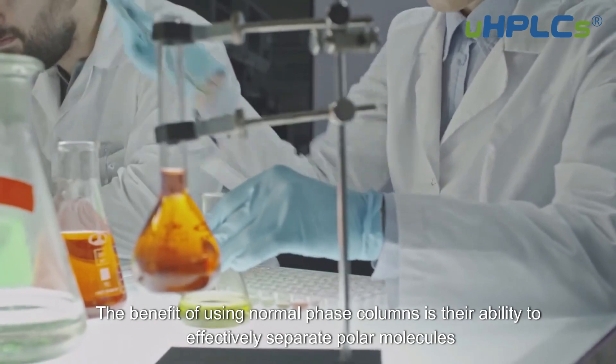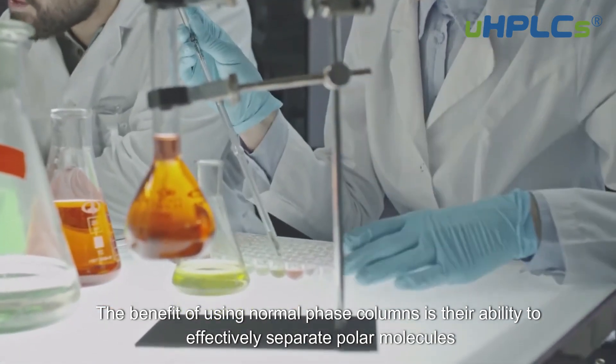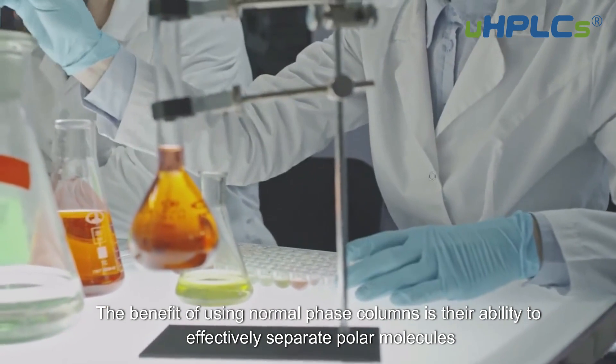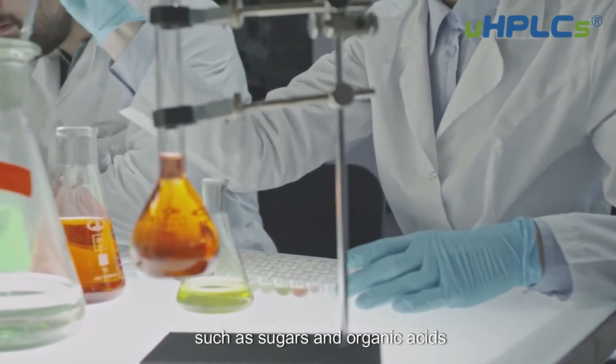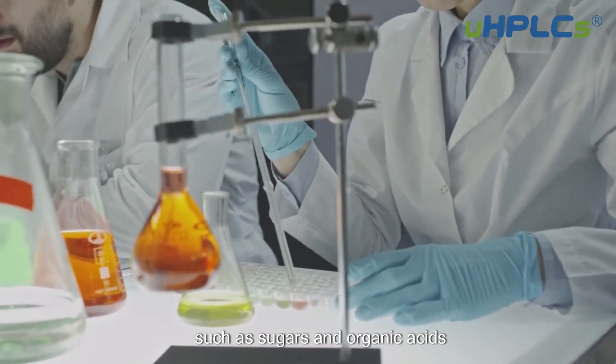The benefit of using normal phase columns is their ability to effectively separate polar molecules, such as sugars and organic acids.